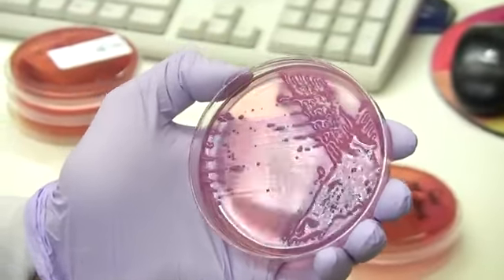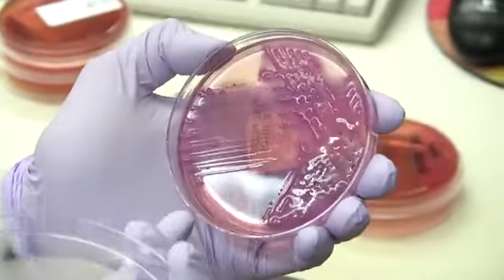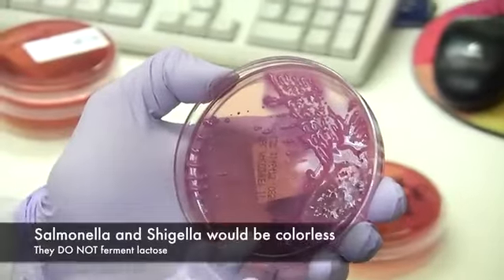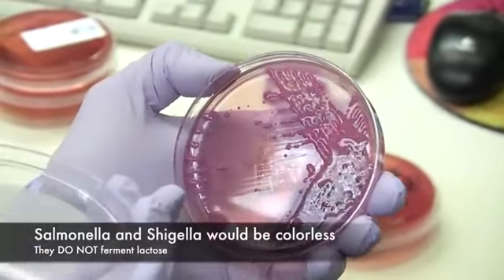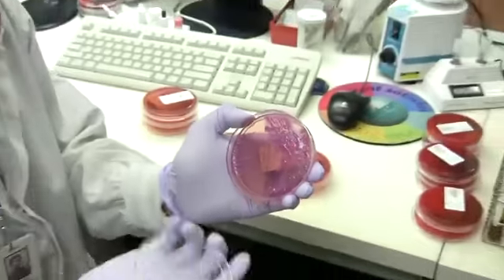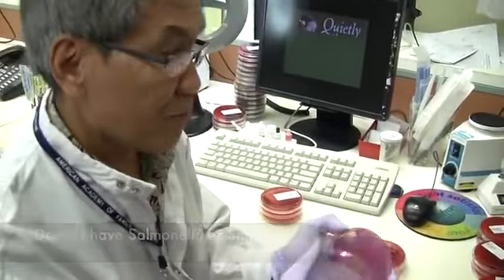Salmonella and Shigella do not ferment lactose. And so, in this case, since they do not ferment lactose, you'll see them as colorless colonies, not pink colonies. In other words, this stool culture does not have any Salmonella or Shigella.